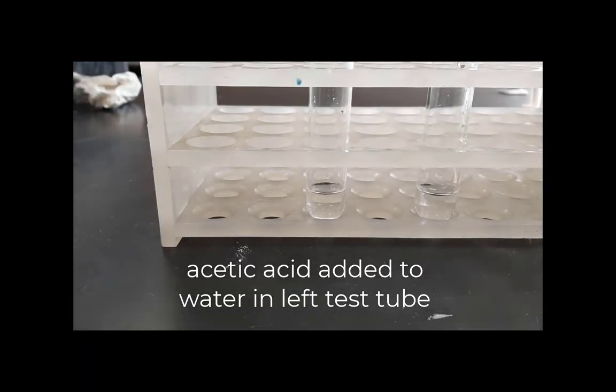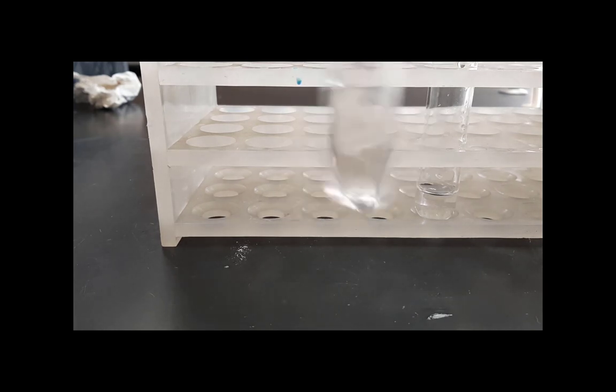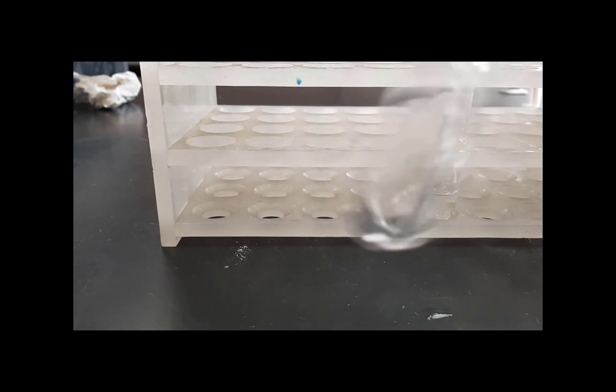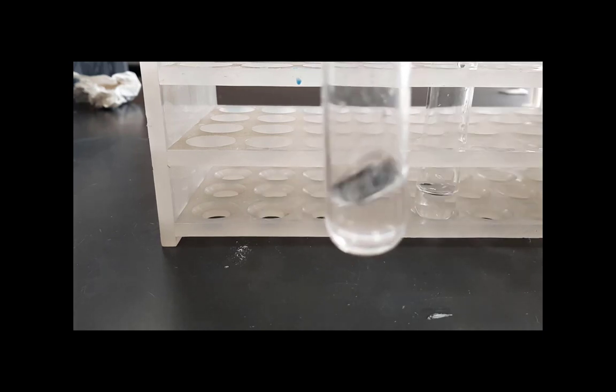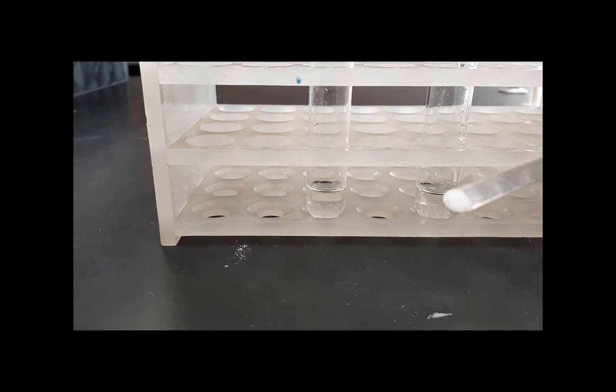I begin by adding acetic acid dropwise to the water in the test tube on the left. After adding several drops, we shake it up and take a closer look. And you notice that there aren't any separate layers. It might have looked like there were bubbles on the bottom, but those were just a trick of the glass. So acetic acid is totally soluble.